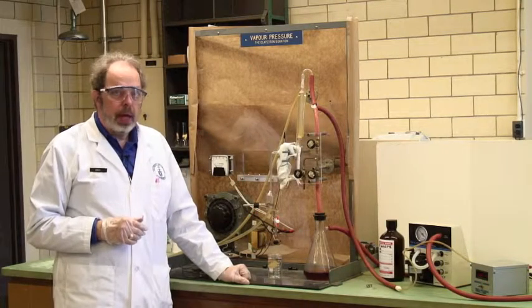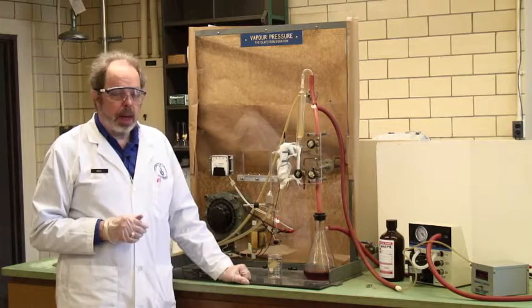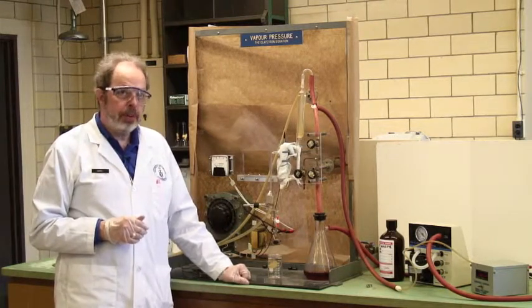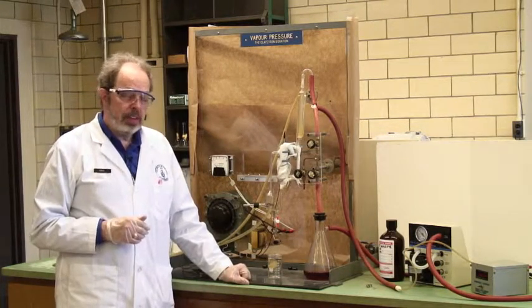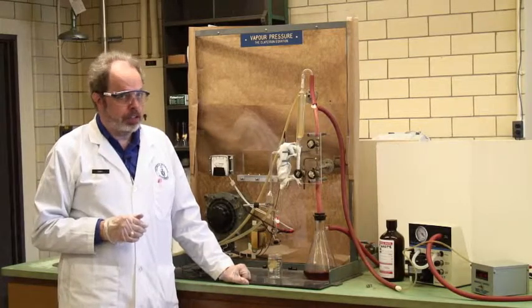This video will show you how to operate the Clausius-Clapeyron equation, where we are measuring vapor pressure, boiling points as a function of external pressure.